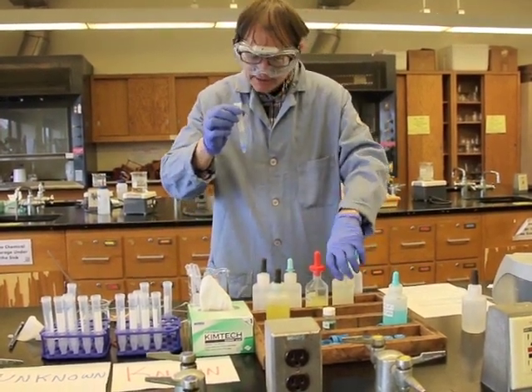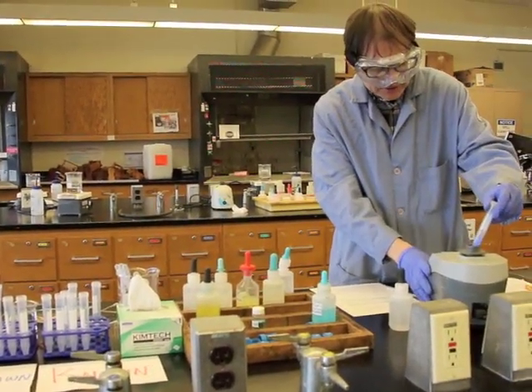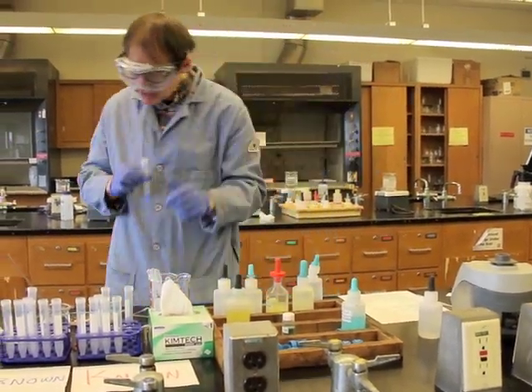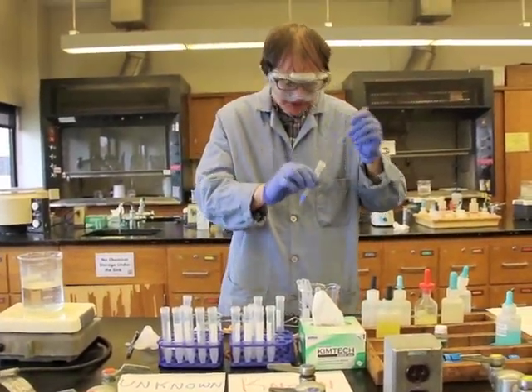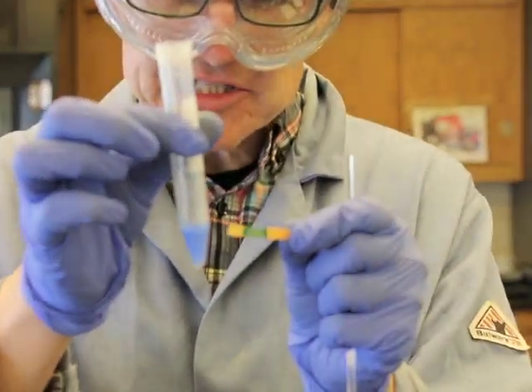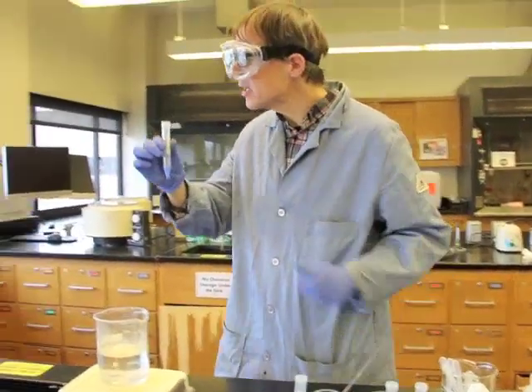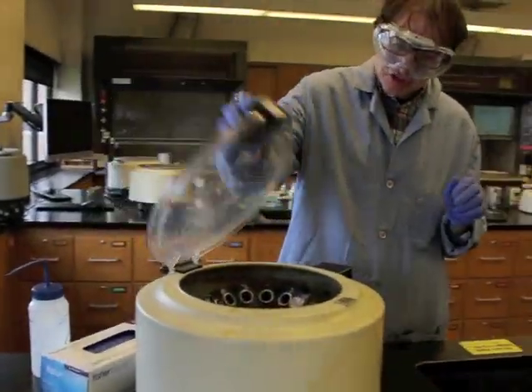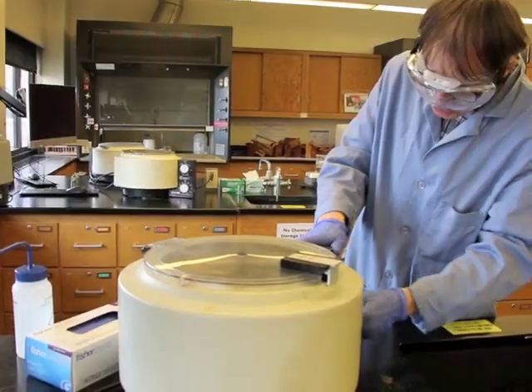Ammonium hydroxide. Once we add the ammonium hydroxide, of course we need to mix it. The vortex mixer will mix this one very nicely. Again, ammonium hydroxide is a base. So if we are adding a base, we definitely want to test the acidity, make sure that this is basic. So taking a drop, if you take a look at that, that pH paper definitely turned green. That means this is sufficiently basic for us to analyze. We come back over here, and we're going to centrifuge this to separate the potential bismuth from the silver and the copper. So we'll set this for 2 minutes.